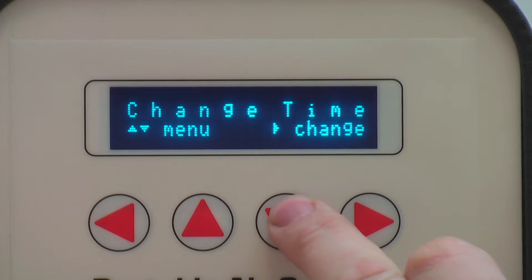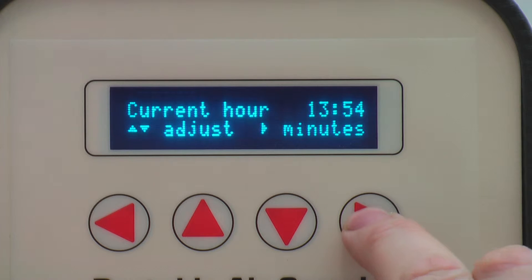You may need to adjust the time and date of the L60IF. Adjust the time by pressing right and adjusting the hours, which are set in 24 hour mode. Press right again to adjust the minutes and alter the minutes by pressing up and down keys. Once you are happy, press right to save the settings.